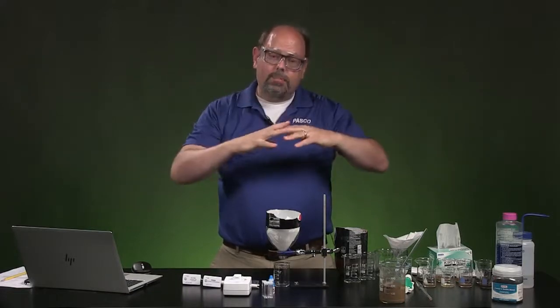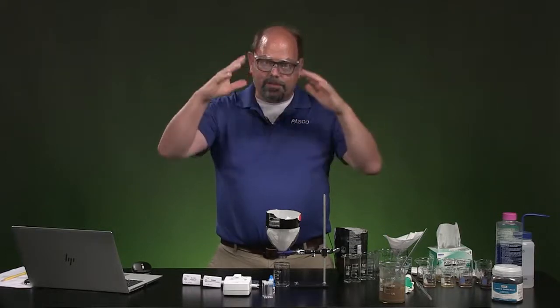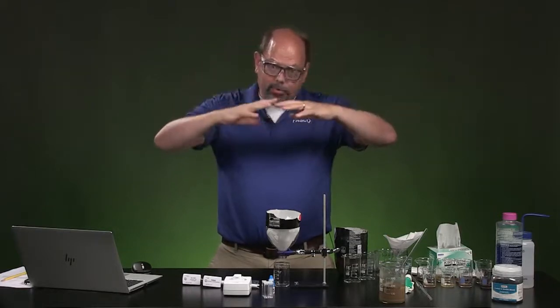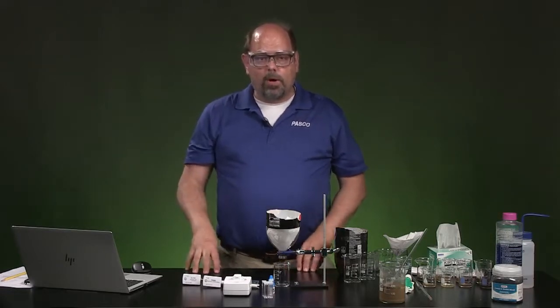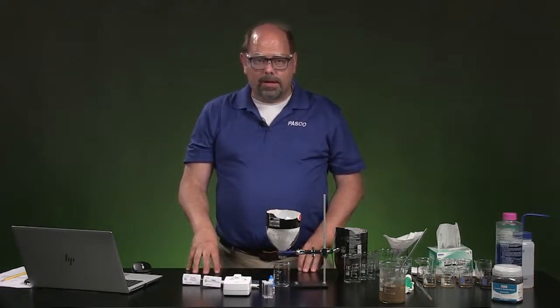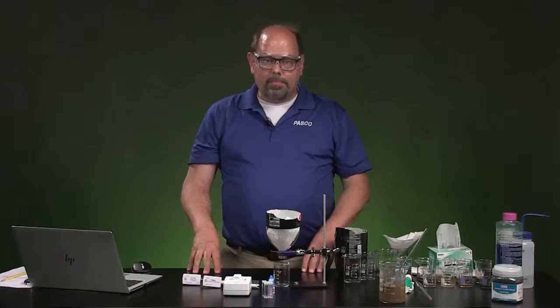And that would bring them together and float to the bottom. They flock with the chemical, looks like little feathers. It's called flocculate. And it brings those out of the water system. Finally, they'll pass the water, which probably has most of the particles out, any of the stuff that makes it look kind of like chocolate milk, and that's been pulled away.